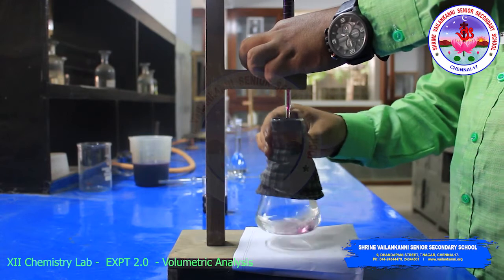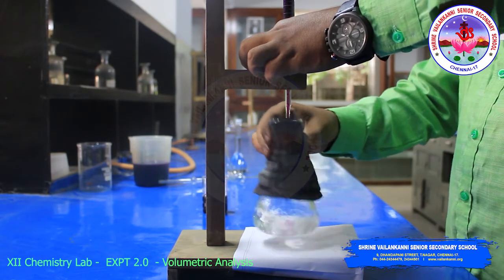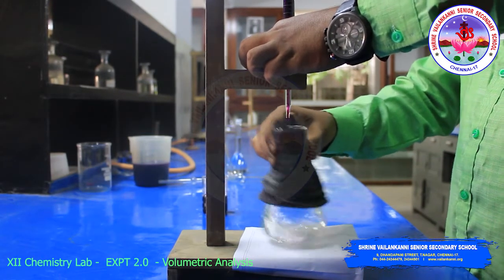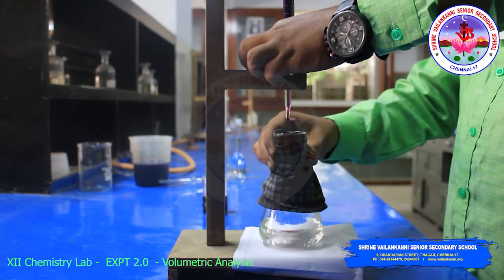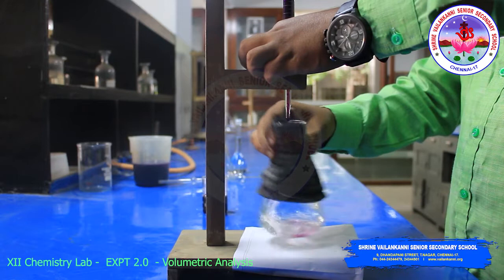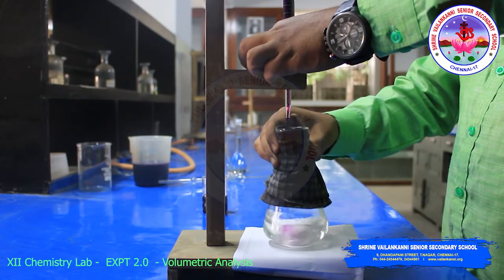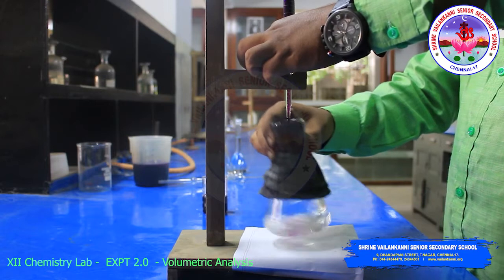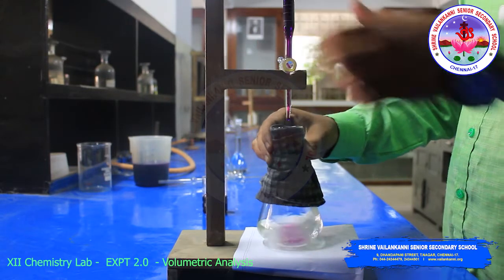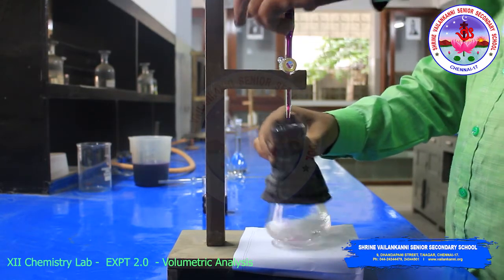You have to do this experiment very carefully. Slowly add dropwise. So I am adding like this only.